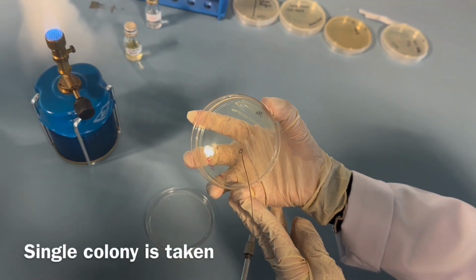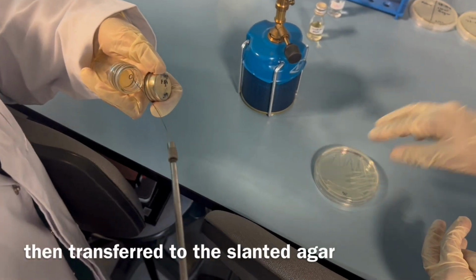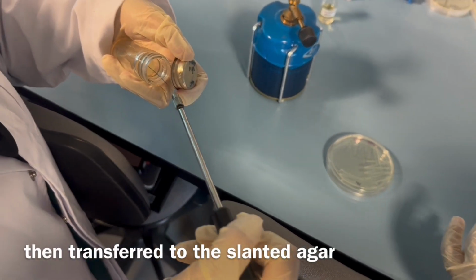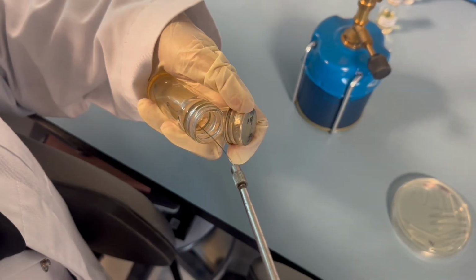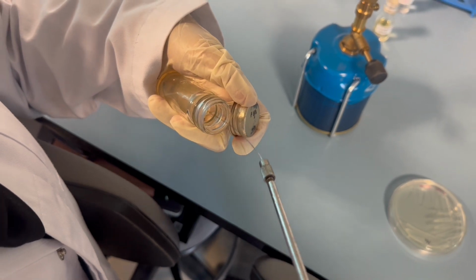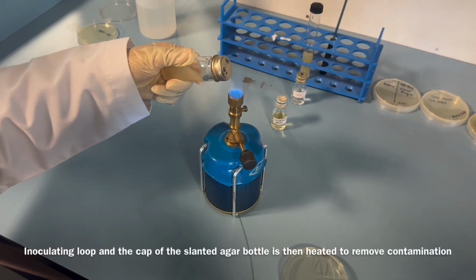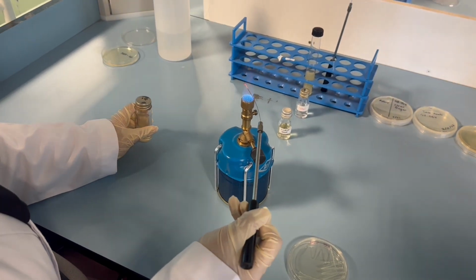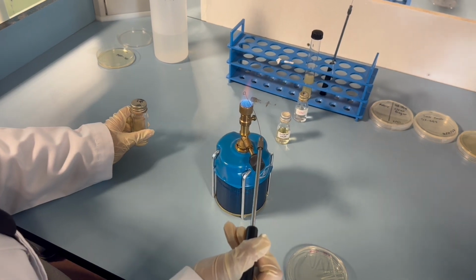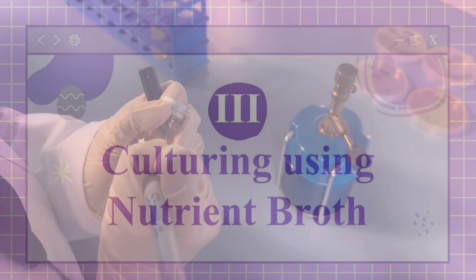And then a single colony of E. coli is taken, then transferred to the slanted agar by streaking, of course. And then the inoculating loop and the cap are heated again to remove any contamination. And then the labeling process is done and incubated.